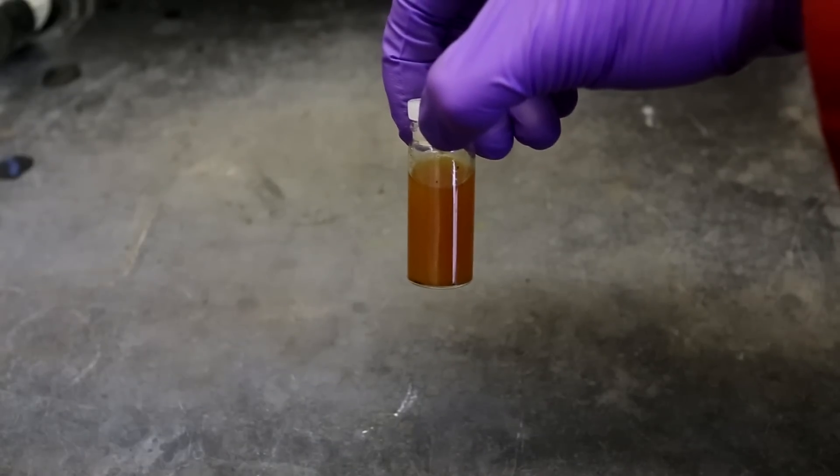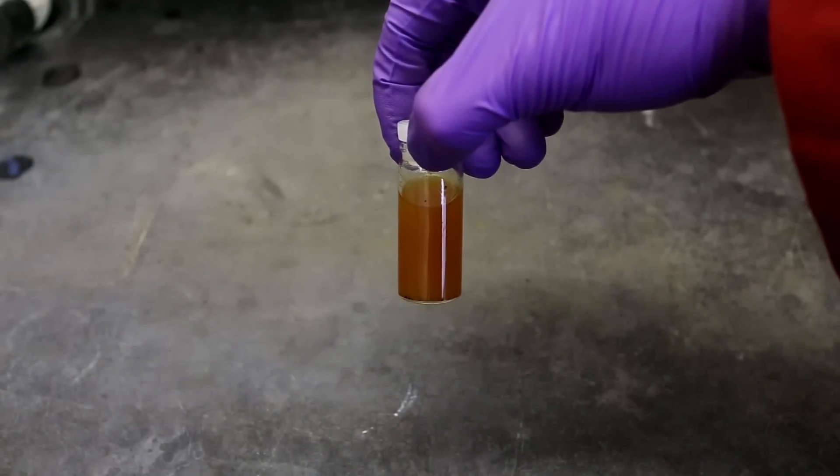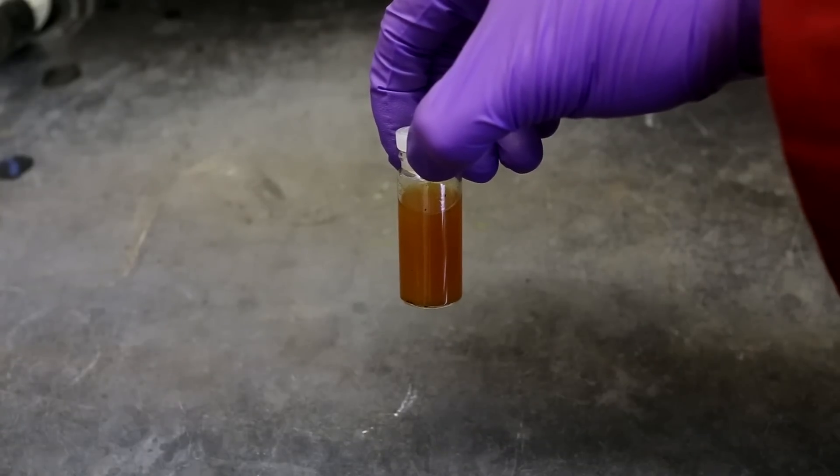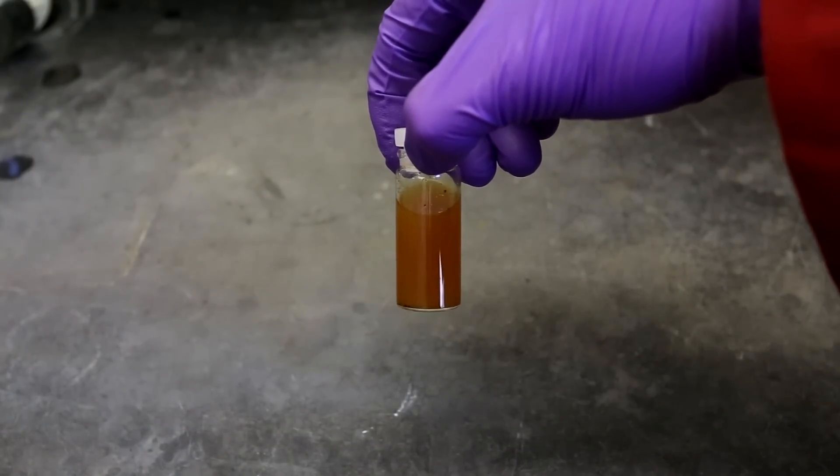I transferred the solution to the small dram vial and immediately capped it. A 100% yield would give about 1 milliliter of cadaverine. However, I'm estimating that we have at most here about a 40% yield.